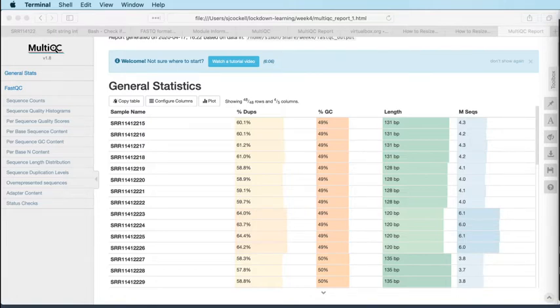People are asking about the viral genome. The SARS-CoV-2 genome is on NCBI. There's a RefSeq for the Wuhan strain. I've got that accession somewhere. I'm just trying to find where, because I've been doing a little bit of analysis against the genome for somebody. So let me just find it.